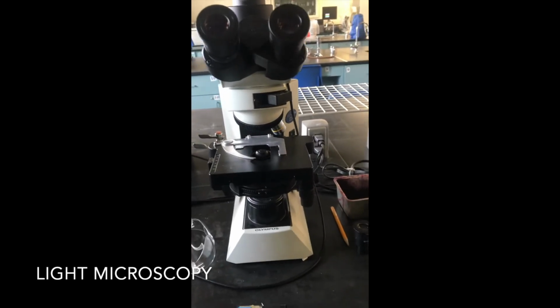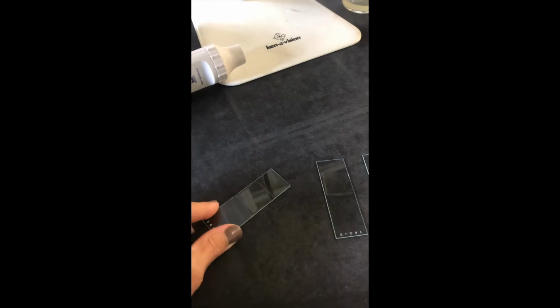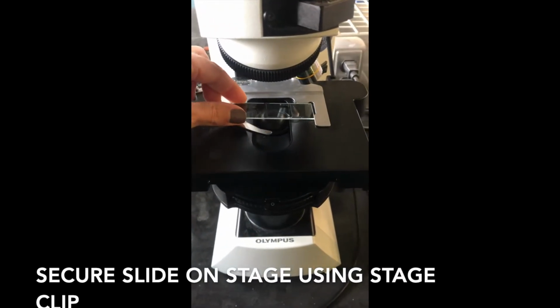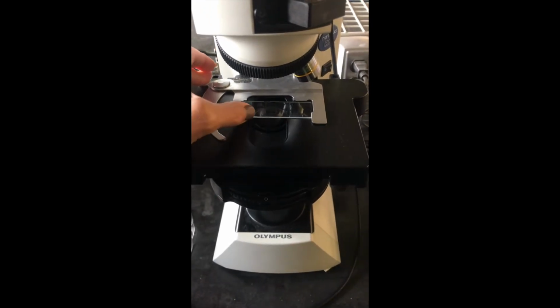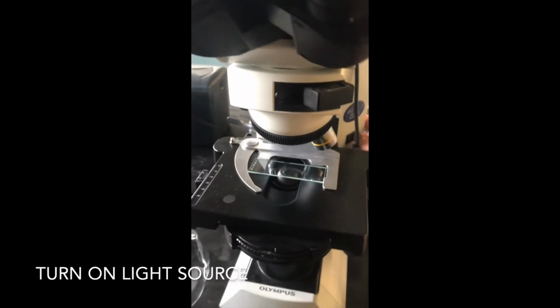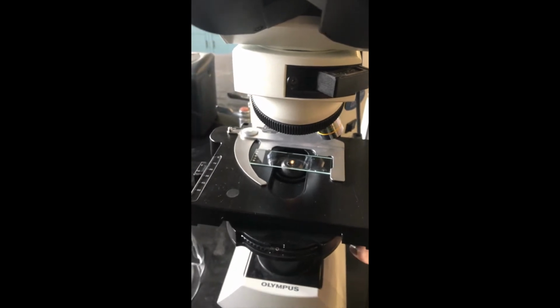This video is going to demonstrate how to use a light microscope. We start off by securing the slide to the stage using the stage clip. Next, we turn on the light source. Here you can see the light shining from the light source through the condenser and through the specimen.